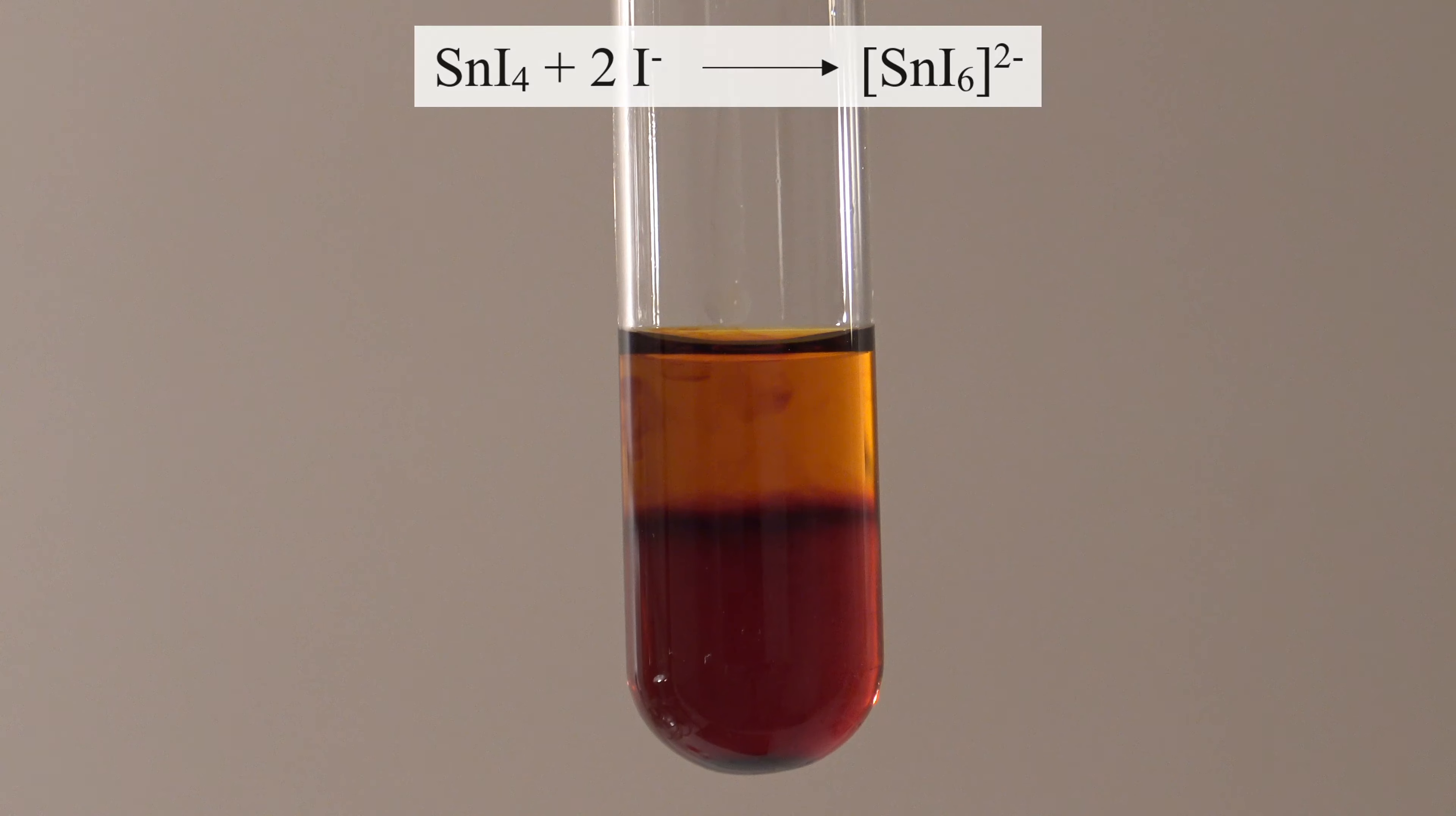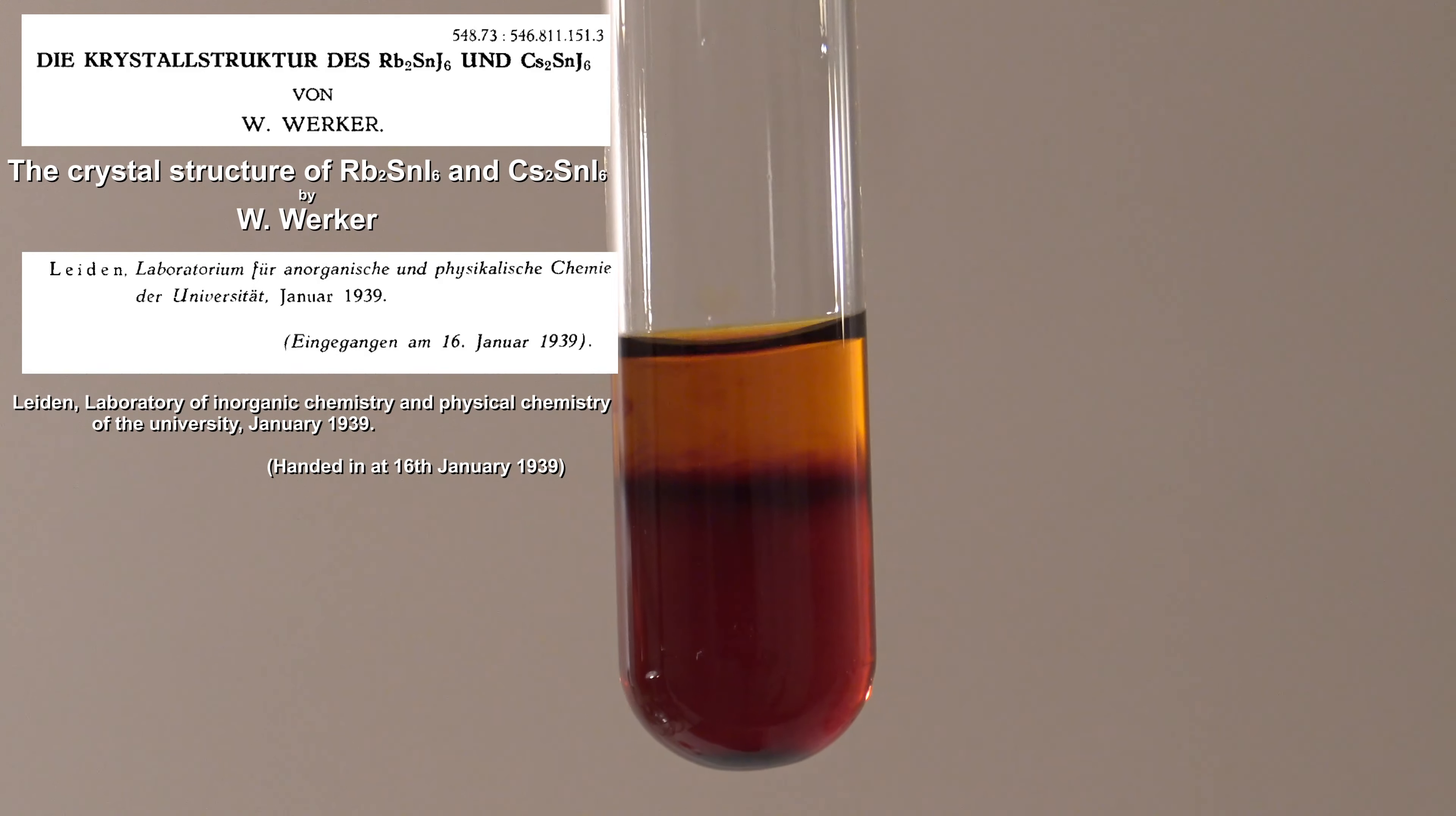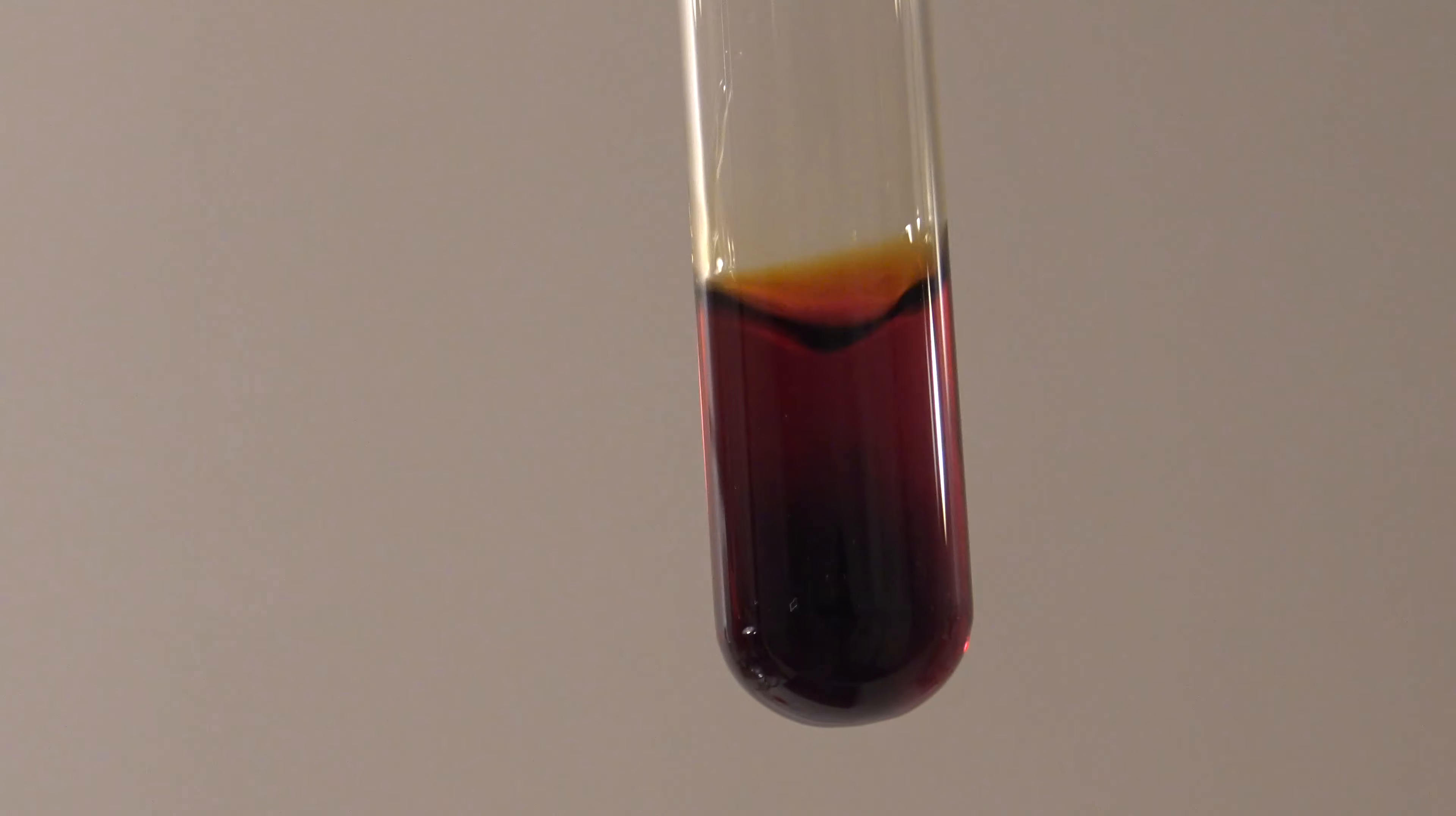But a slight smell of iodine and the color of the solution did seem odd, so something else might have happened. An old German paper said that the complex is only stable with rubidium or cesium as the counter ion of the complex. Unfortunately, I didn't have cesium or rubidium iodide at hand to test it.